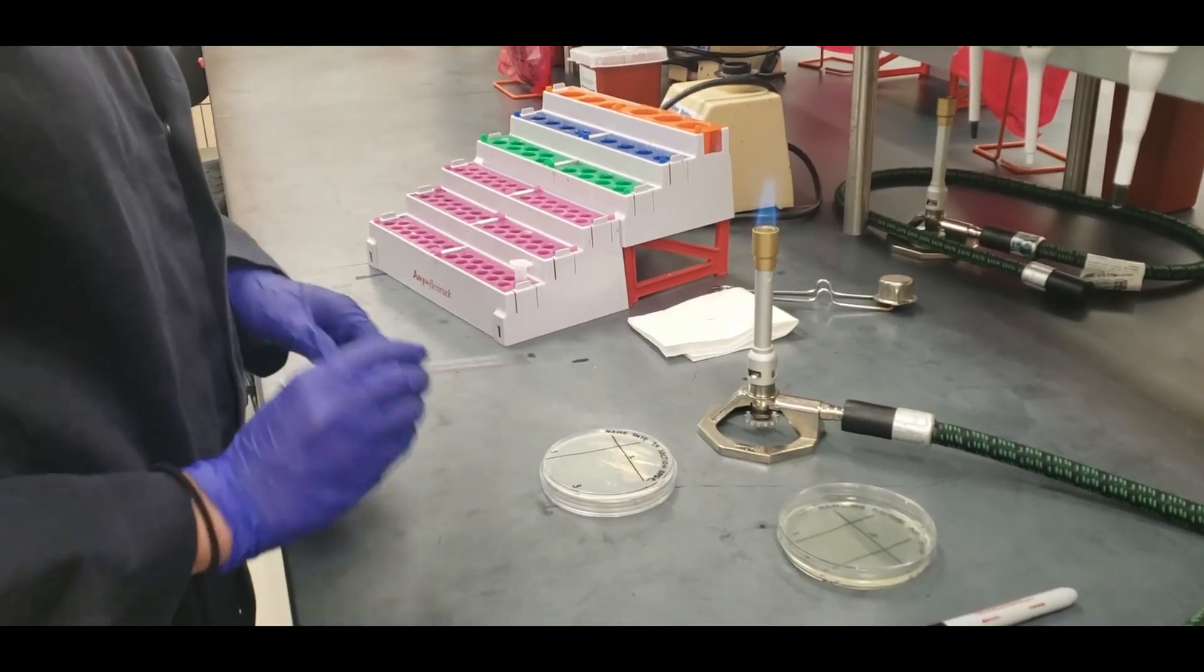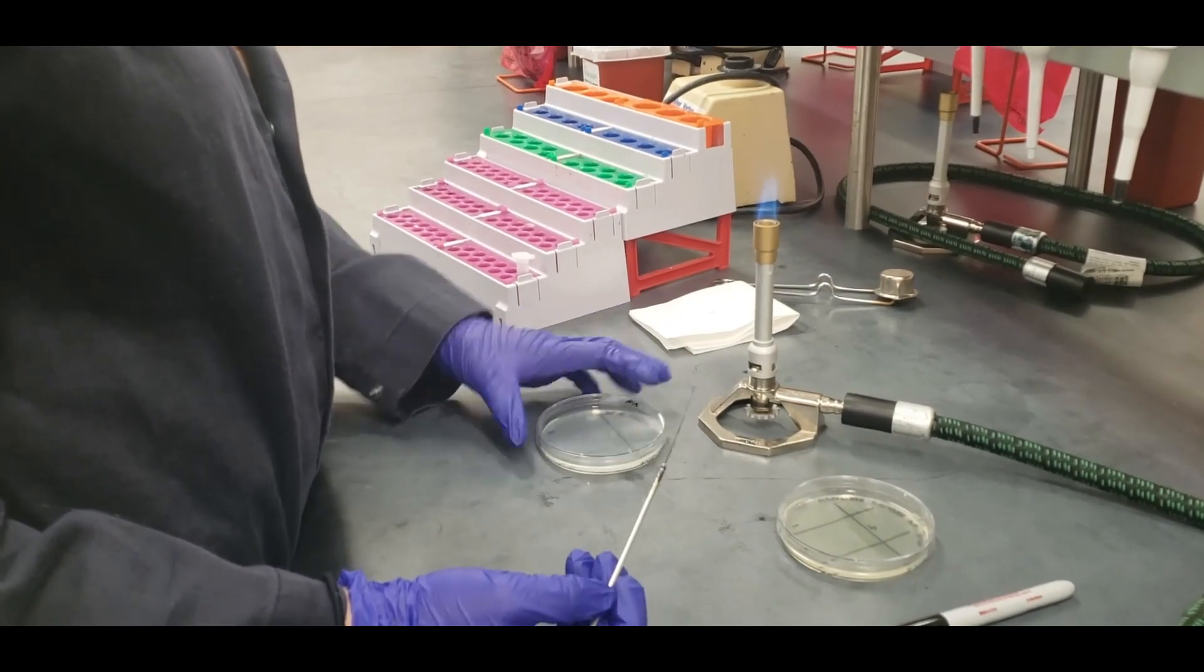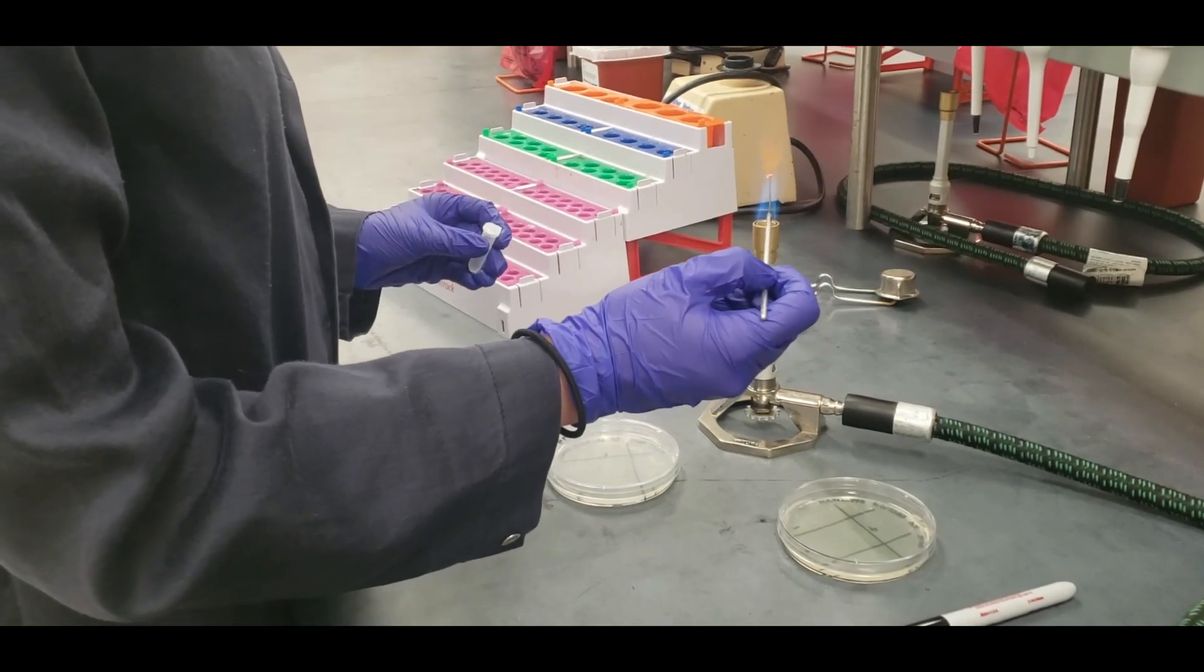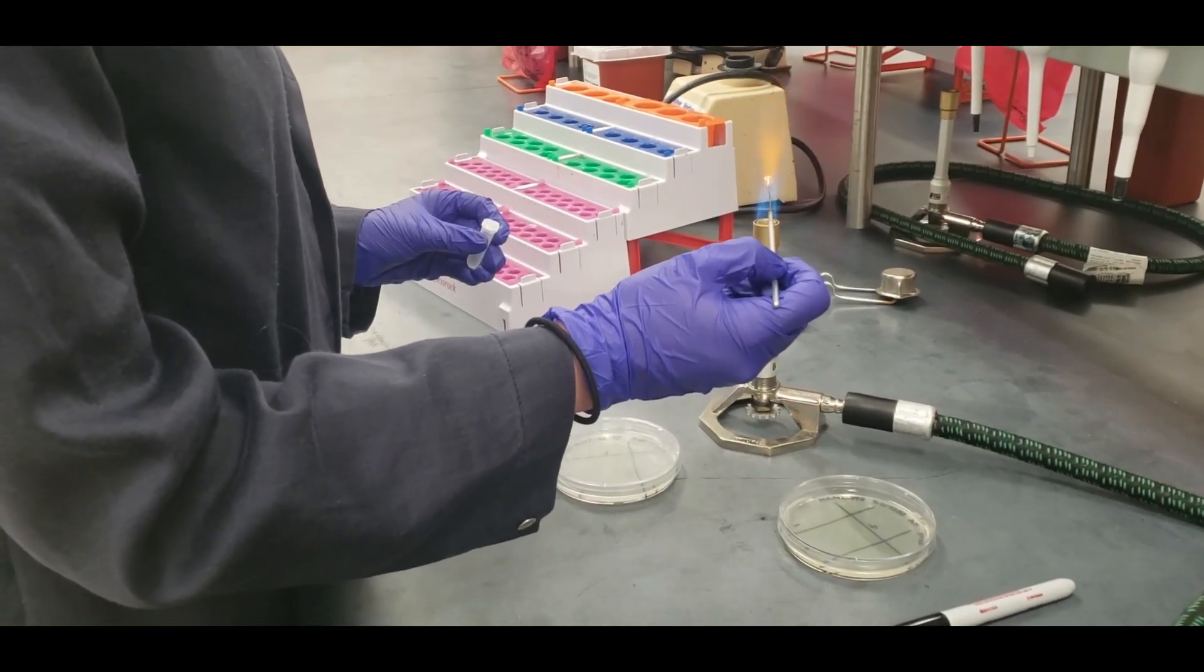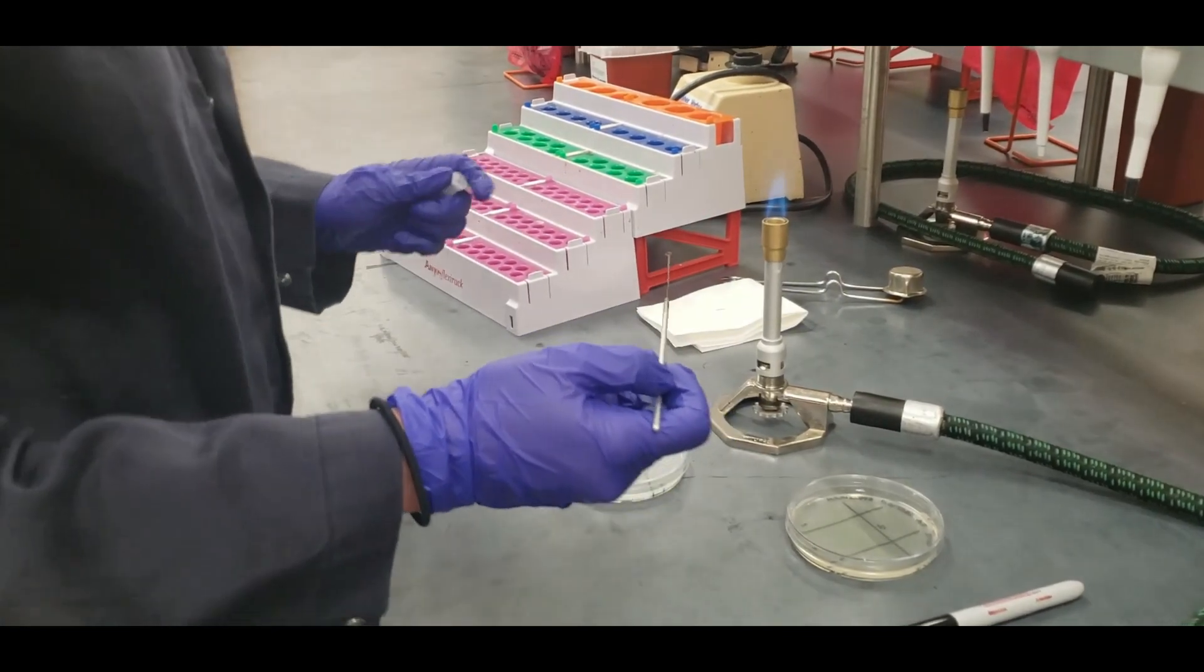You're going to flip your plate over and you're going to sterilize your loop. Make sure you let it cool before sticking it into your culture.